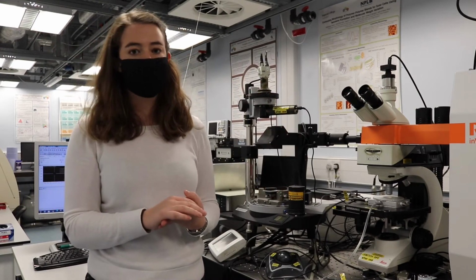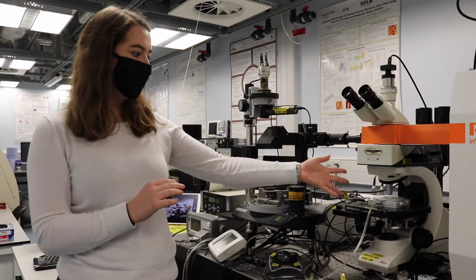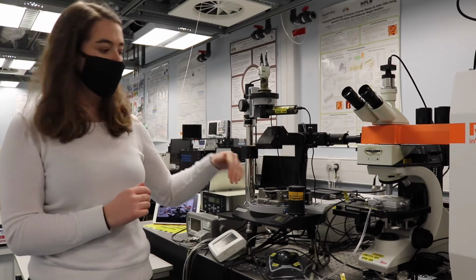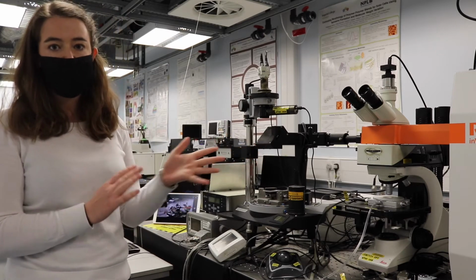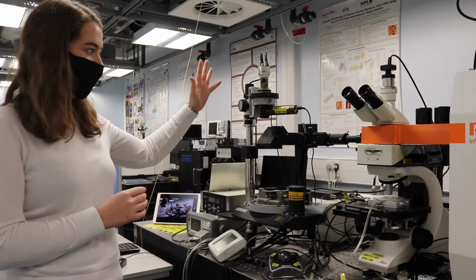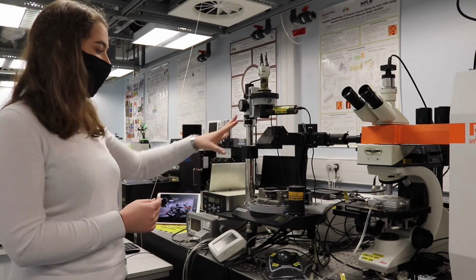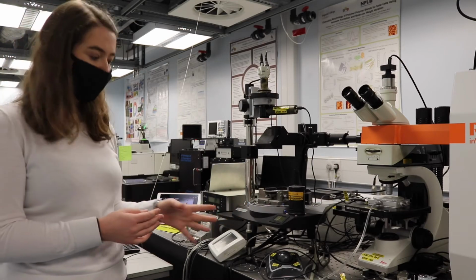One of the things we specialise in our group is doing in situ measurements. So shown here we can measure the Raman spectroscopy whilst under electrical bias or whilst under gas exposure for our sensing. We can also do Raman spectroscopy at the same time as the AFM using this sample stage here.